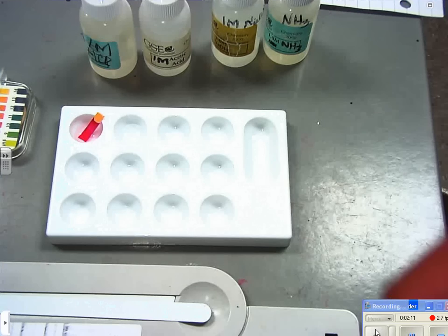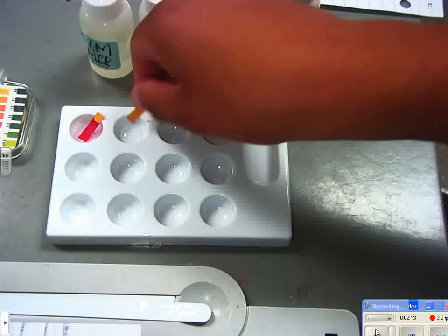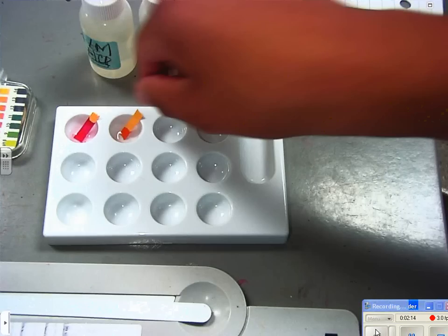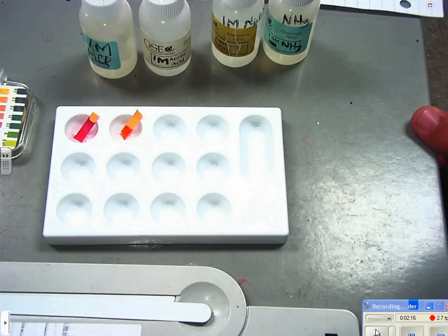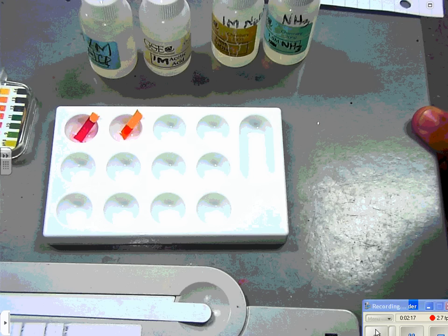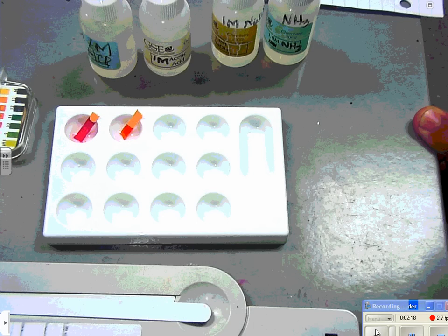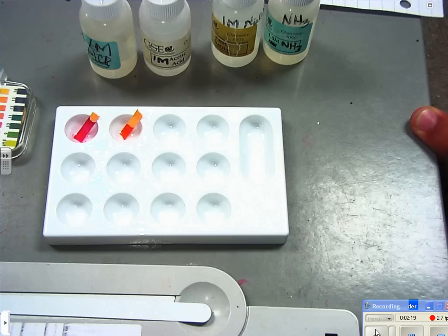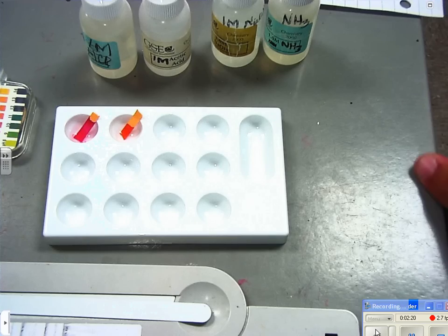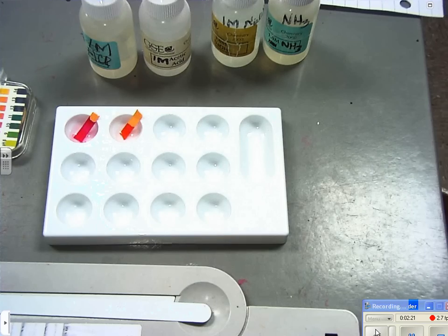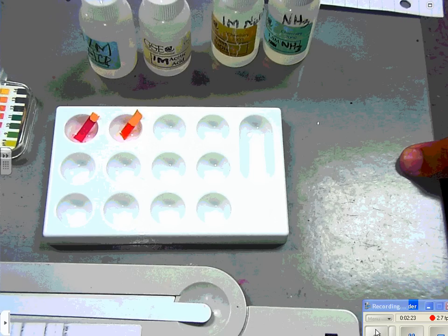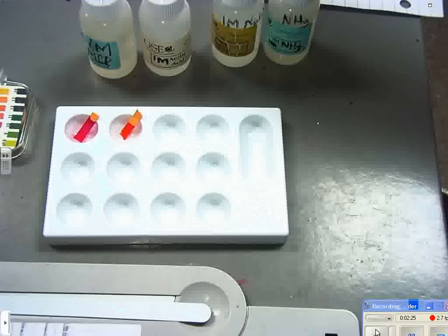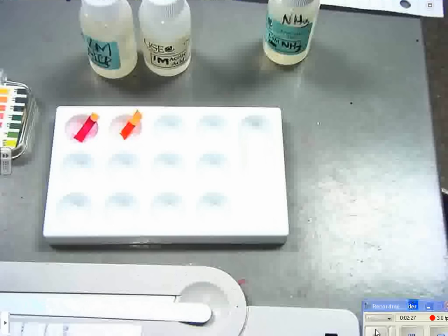You have to test the pH of acetic acid. Here's our acetic acid. What would you call the pH on that? Four. Let's record that as a four and carry on. Then you have to put five drops of sodium hydroxide.